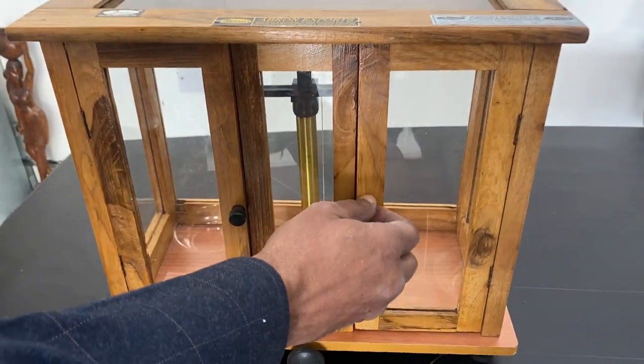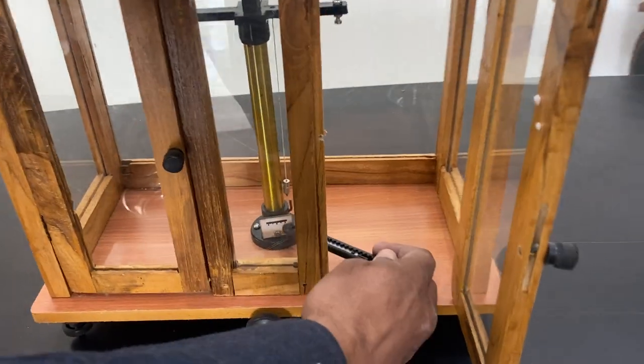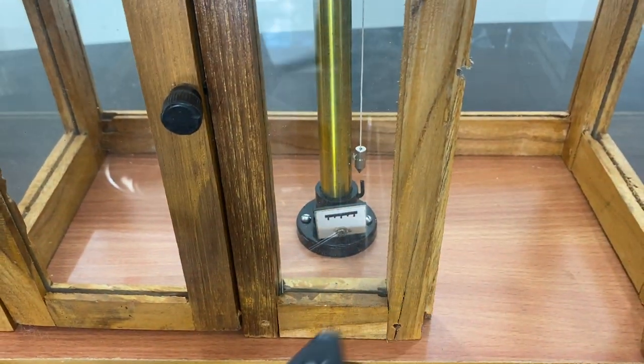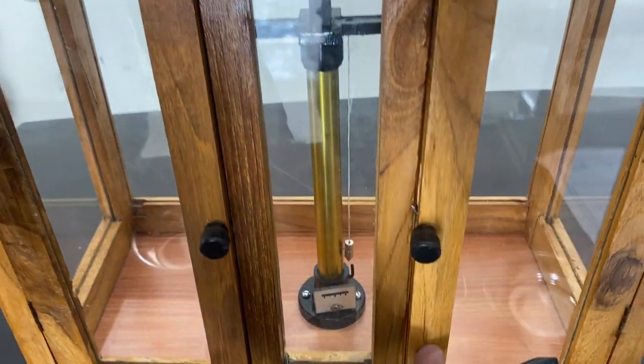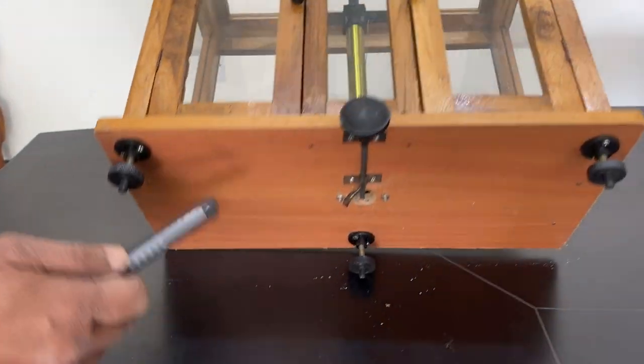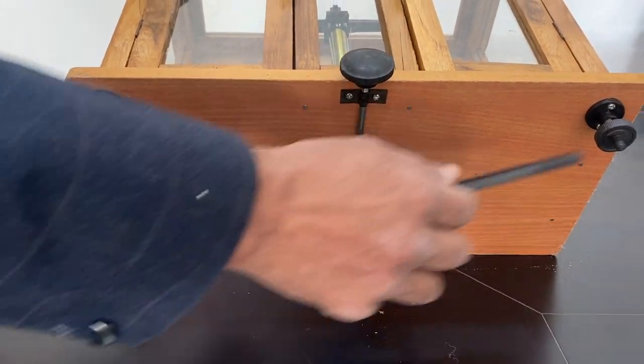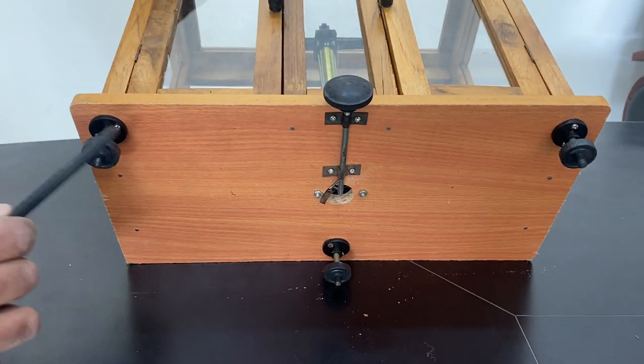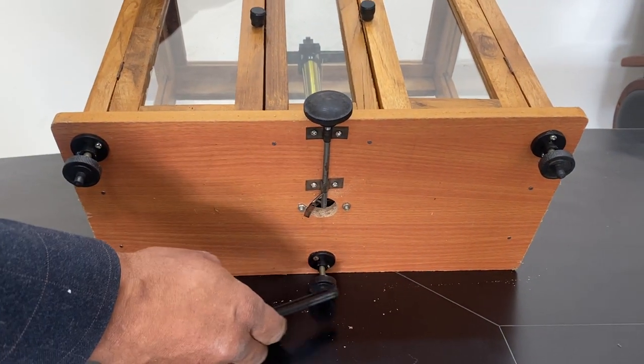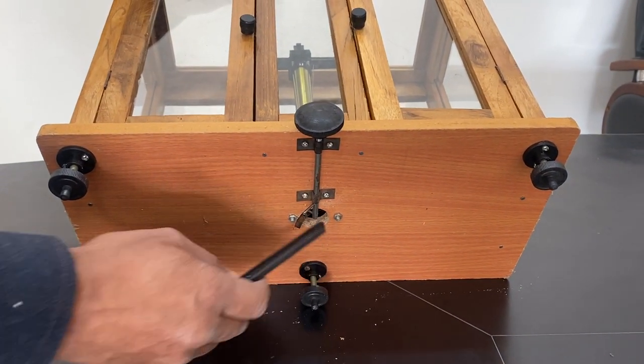Inside there is a scale and a plumb line for balancing the level. Below are three leveling screws on the front - sometimes two, but we now provide the third one as well.